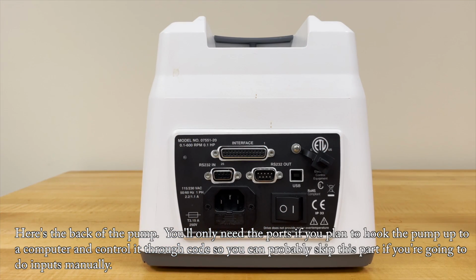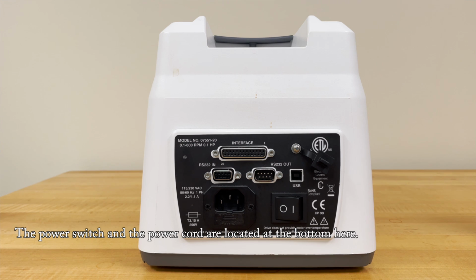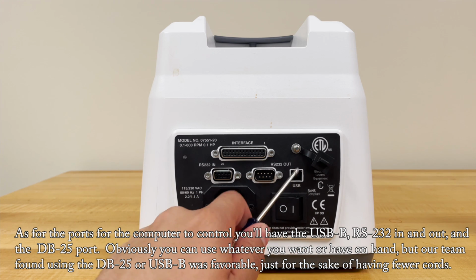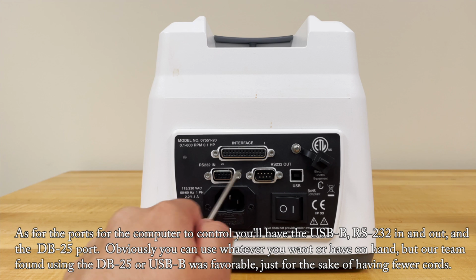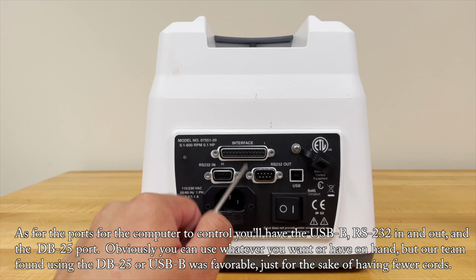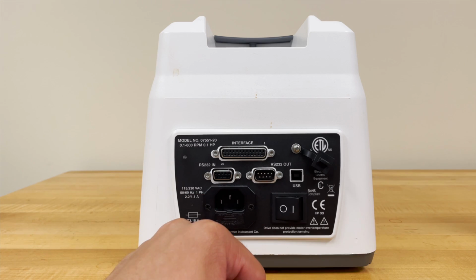Here's the back of the pump. You only need the ports if you plan to hook the pump up to a computer and control it through code, so you can probably skip this part if you're going to do inputs manually. The power switch and the power cord are located at the bottom here. As for the ports for the computer to control, you'll have the USB-B, RS-232 in and out, and a DB25 port. Obviously, you can use whatever you want or have on hand, but our team found using the DB25 or USB-B was favorable just for the sake of having fewer cords.